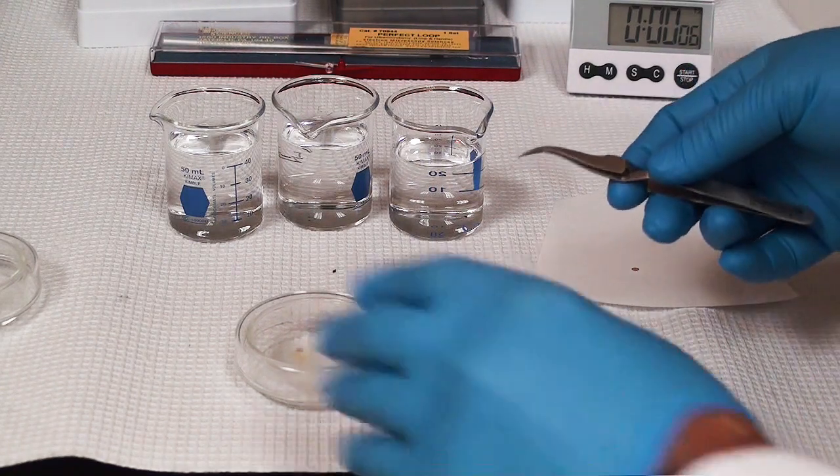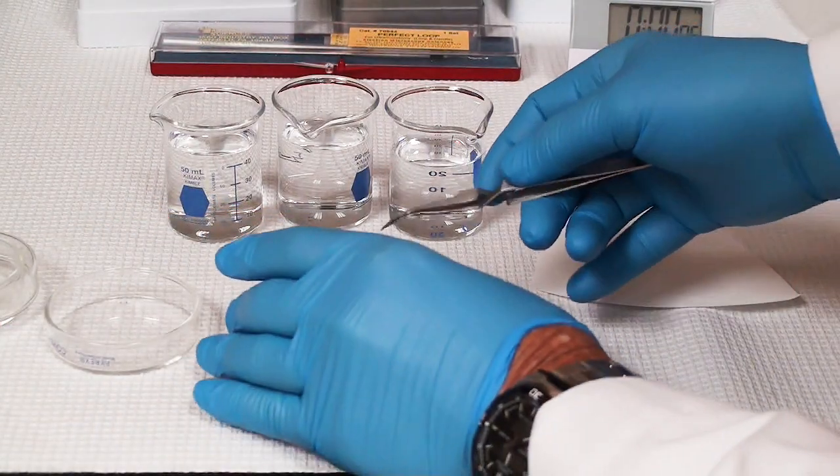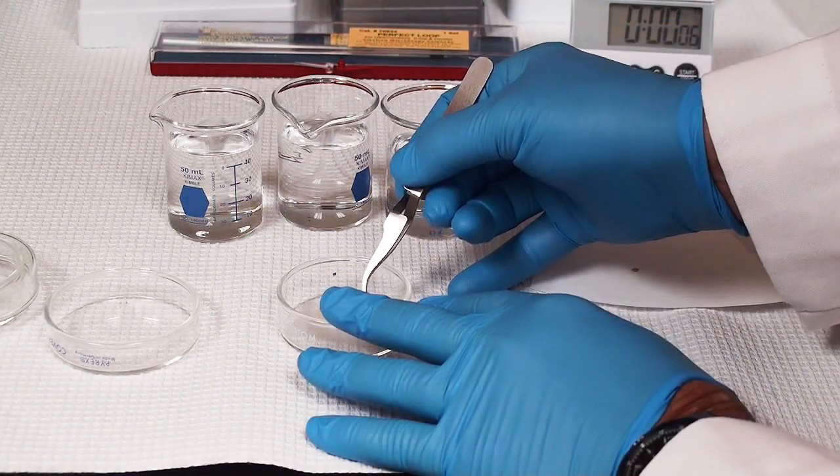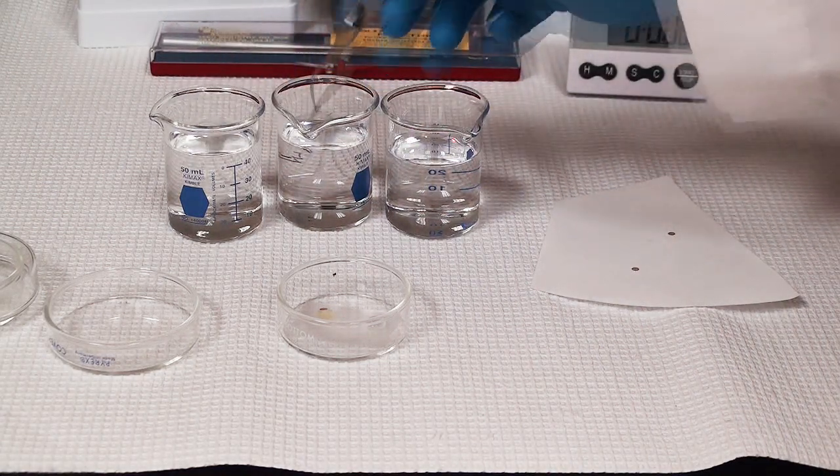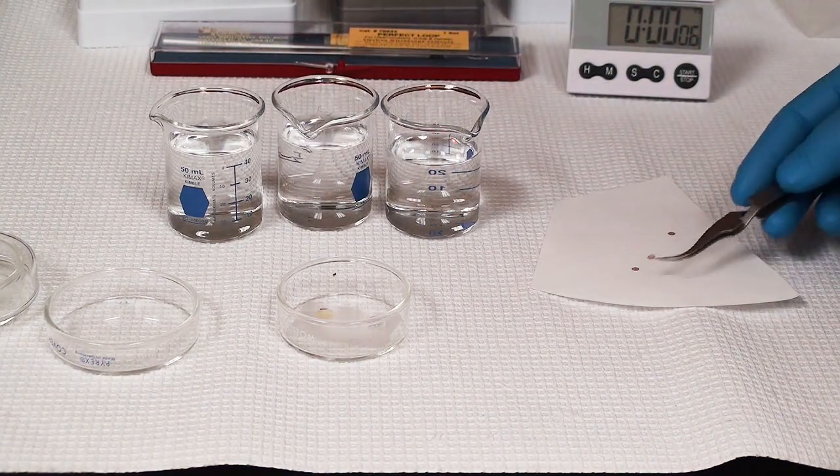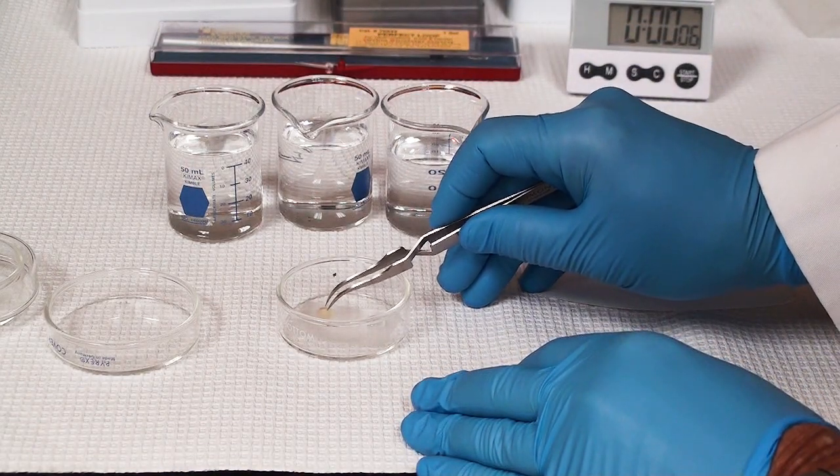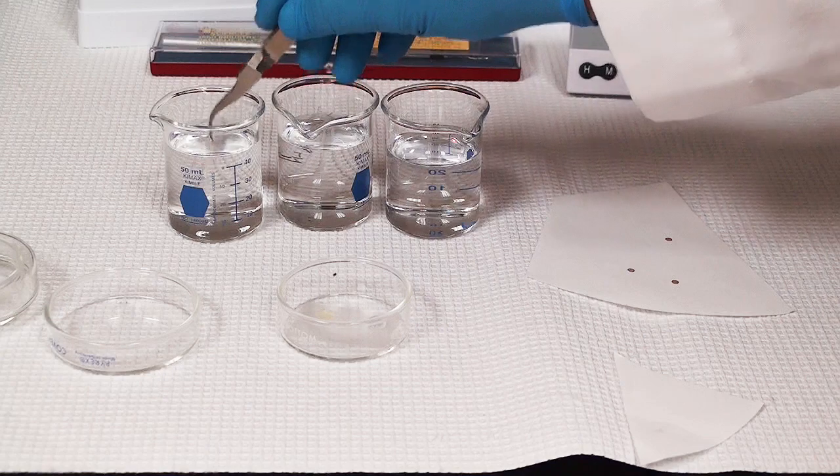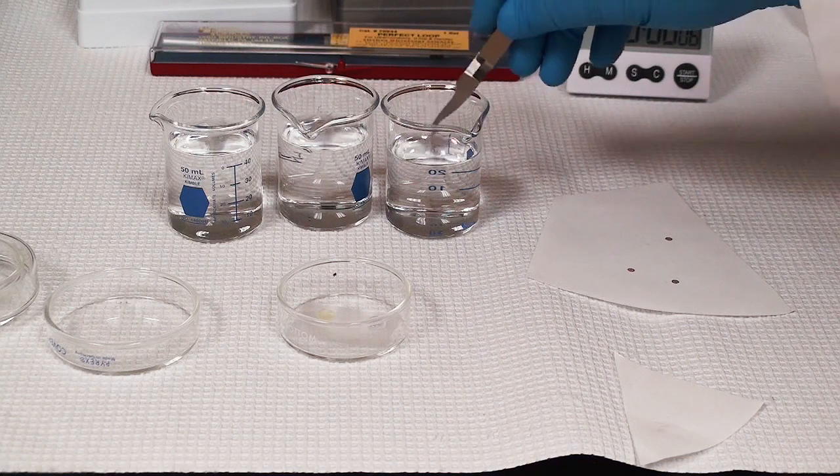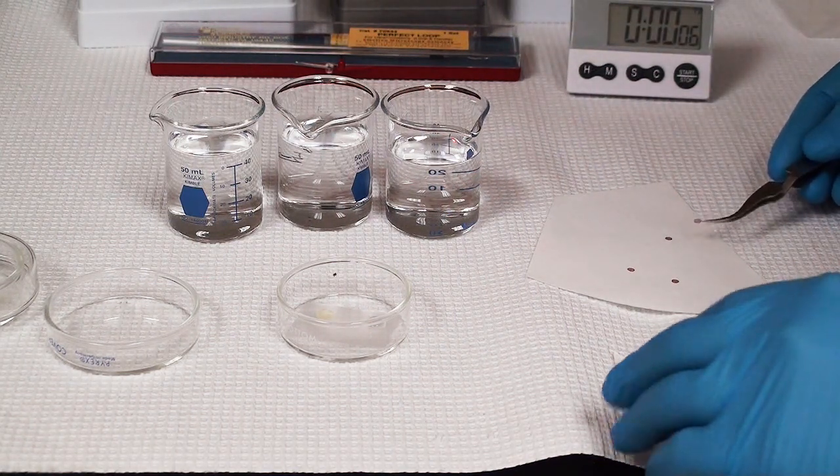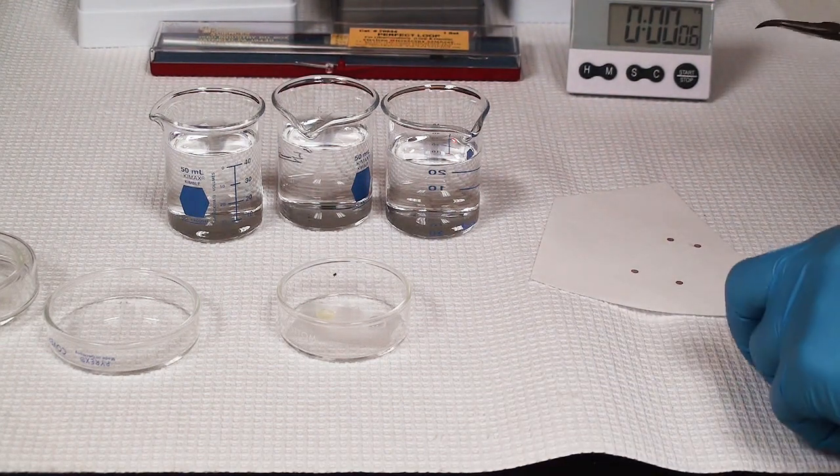My room temperature is now ready to go. I have those microwave ones there. Now I'm going to rinse the room temperature ones. I have the uranyl less and uranyl acetate. I'll do my fast dip procedure here again. I know it's exciting watching rinsing grids. When you rinse them, always go up and down. Don't go back and forth, because otherwise you could break that thin membrane that is your section.